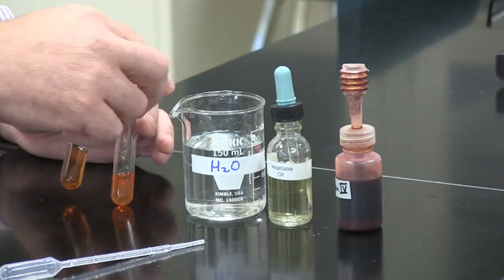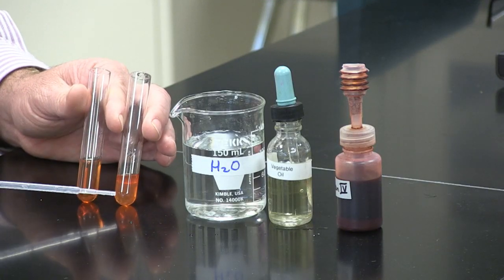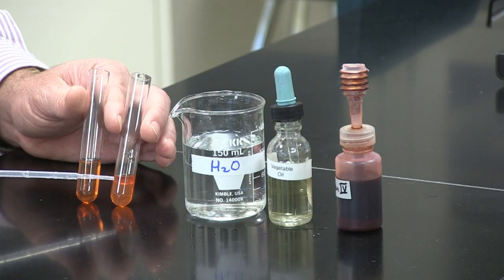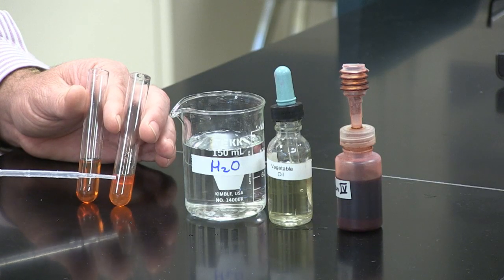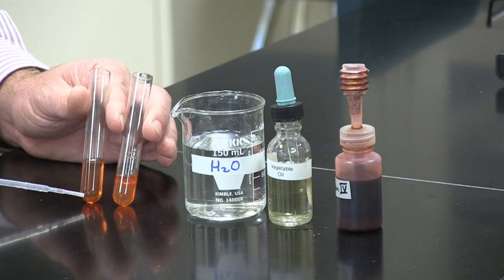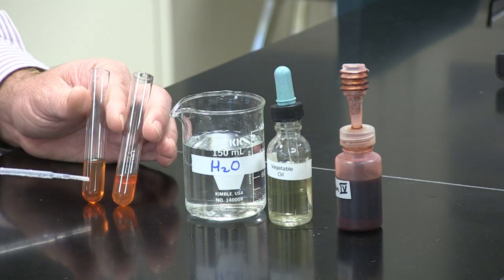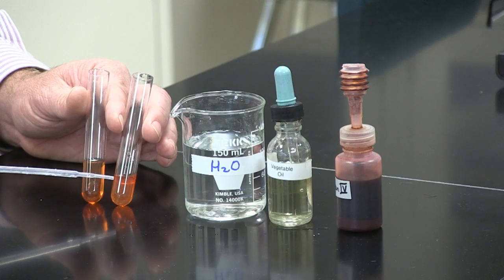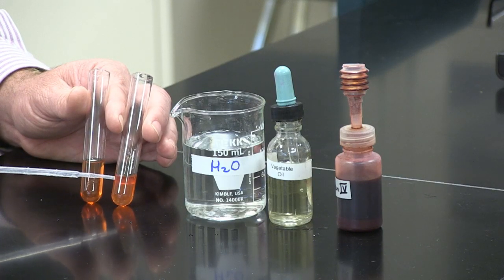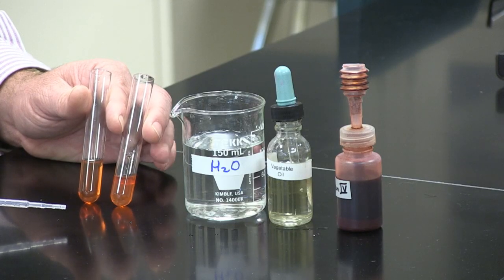Now, you can see that oil is indicated in this test tube because there's clearly a dark red layer, whereas in this test tube the Sudan is deposited uniformly. So Sudan has stained the lipid-based substance, the vegetable oil, a dark red.